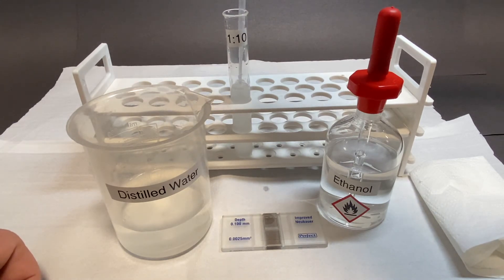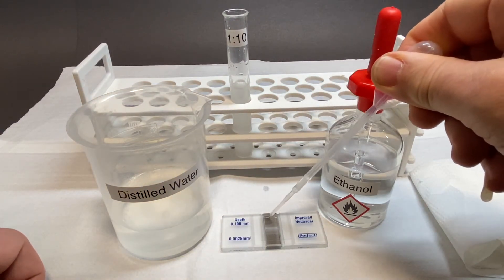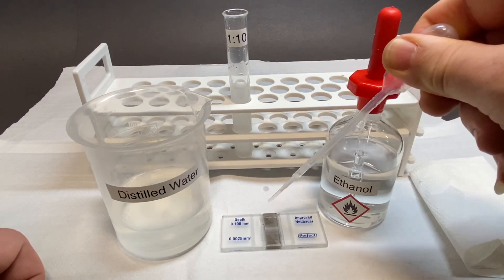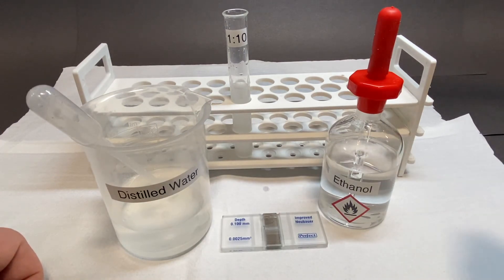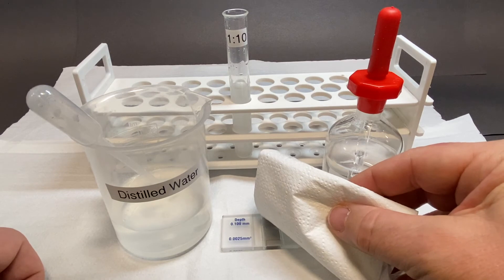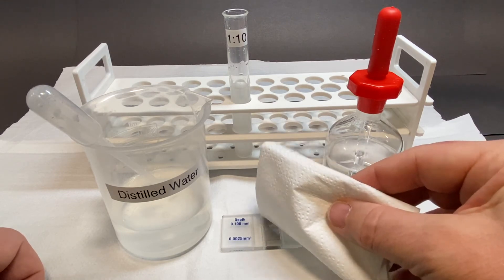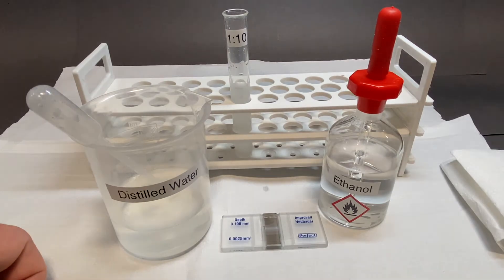Draw a sample of yeast into the pipette and discharge it back into the test tube. This ensures that any settling of the suspension will be counteracted by movement. Then gently touch the pipette against the edge of the coverslip to allow capillary action to draw the sample underneath the coverslip. Gently dab away any excess liquid from the surface of the coverslip itself.